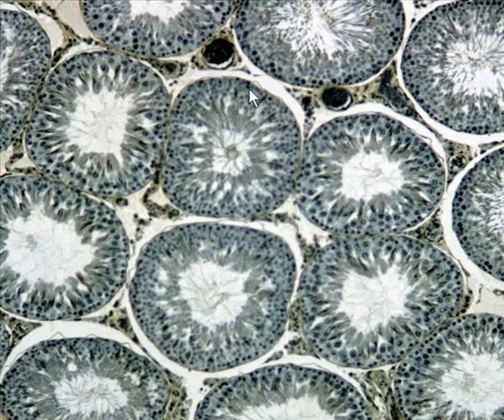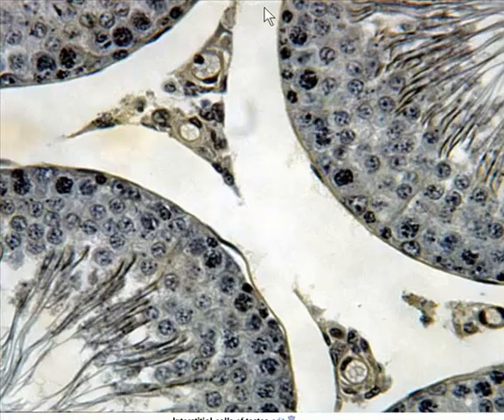Now, the lab manual and the book, of course, talk about the different developmental stages of the sperm. And if we zoom up a little bit, here we're seeing just one section of a seminiferous tubule, and so you'd have immature cells out here, like spermatogonia they're called. And then as we go closer and closer to the lumen, you would have more and more mature sperm cells. So you go primary and secondary spermatocytes, and then spermatids, and then spermatozoa once you're on the inside here.